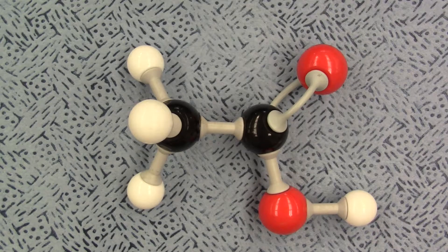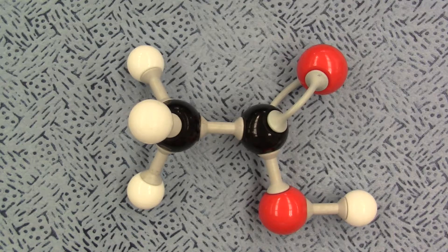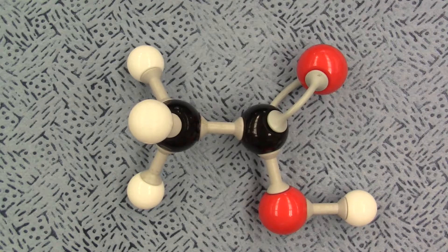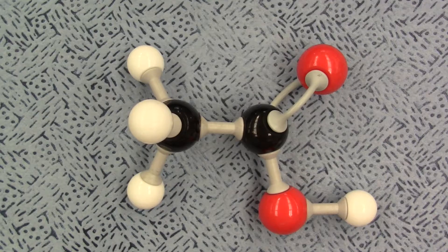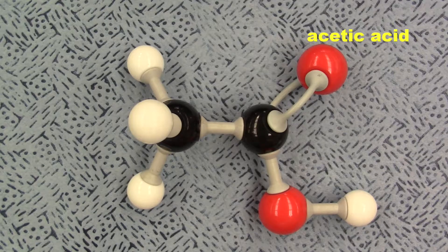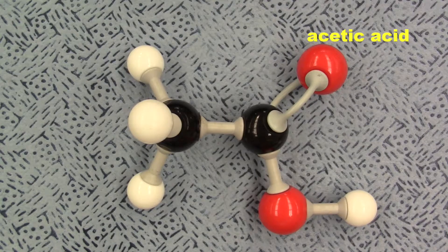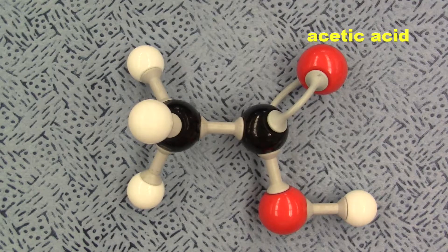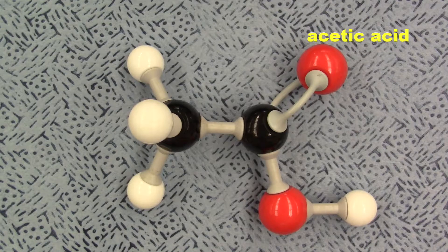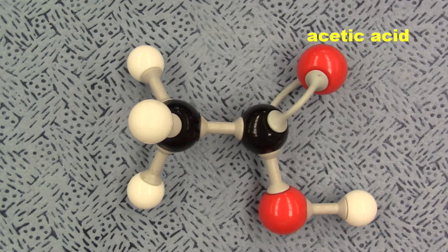Okay class, now we're going to start drawing some molecules for organic modeling compounds. You have to draw this in your data sheet. If you don't know how to draw this or you're not familiar with what you're looking at, go watch the pre-lab video where I explain it all. Remember, I'm just your lab partner, I'm a set of hands. You have to draw this yourself.